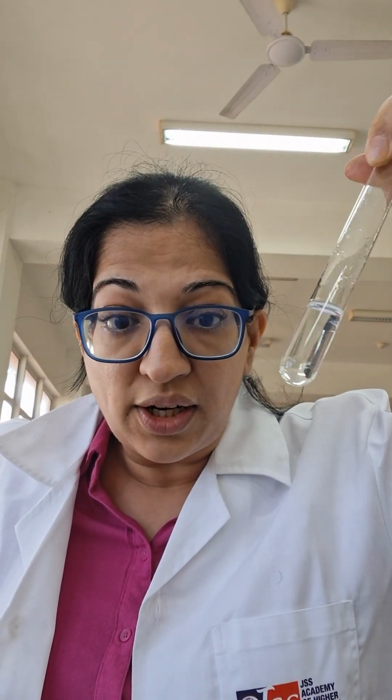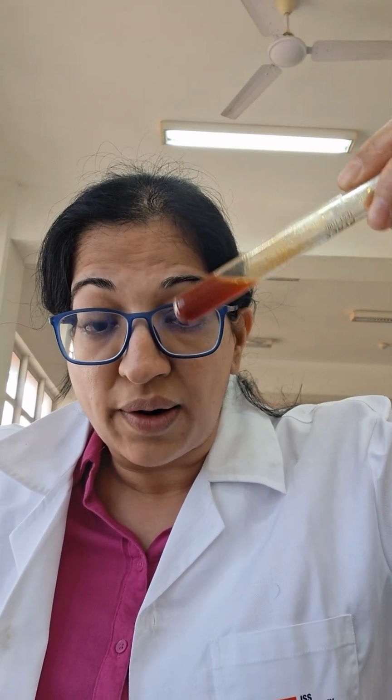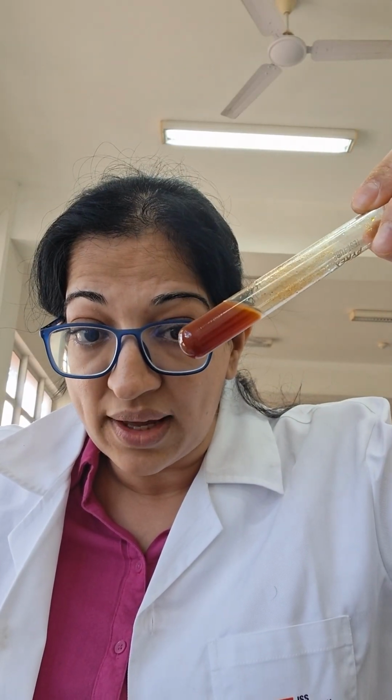On revoit tout maintenant. Calcium in NaOH, white precipitate, which does not dissolve. Potassium chloride in NaOH. Potassium salt in NaOH, colorless solution, which remains colorless with NaOH. Iron 3 salt, reddish brown precipitate with NaOH, which does not dissolve.